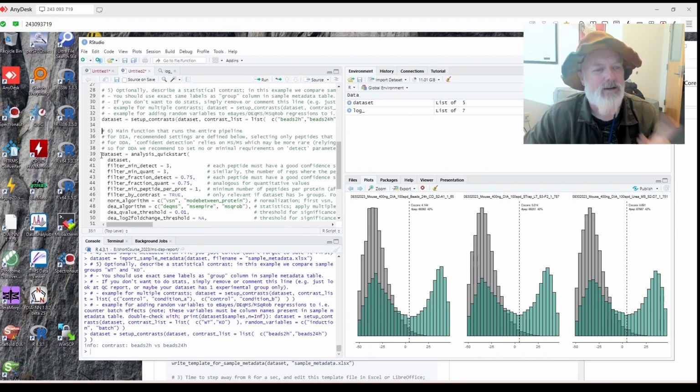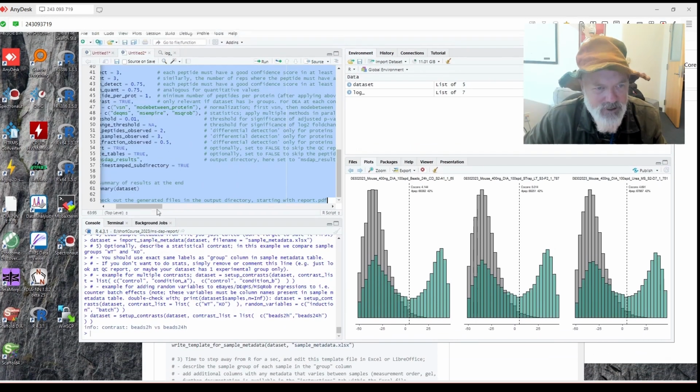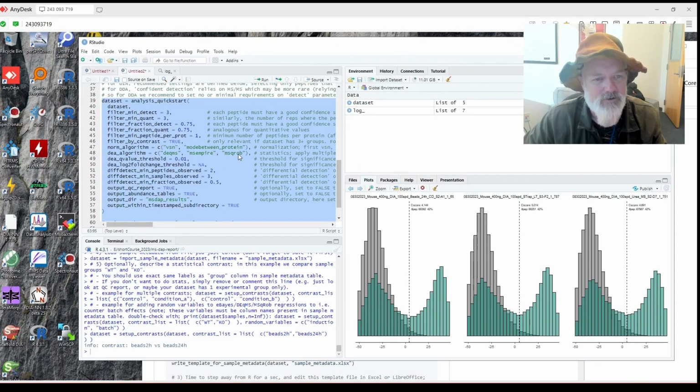And then this is the part I'm going to pause and come back, because it might take like half an hour. Okay, so basically I'm going to start this. I'll highlight both of these, and I'm going to print the data set too, which will give us the PDF of all the cool figures.